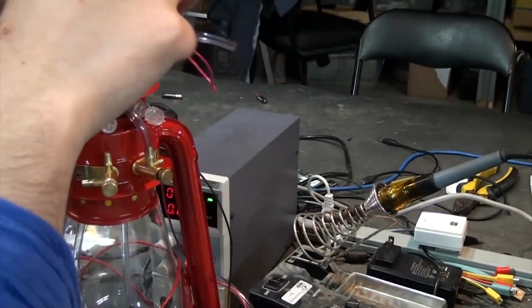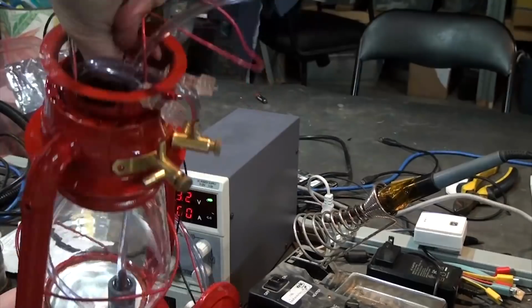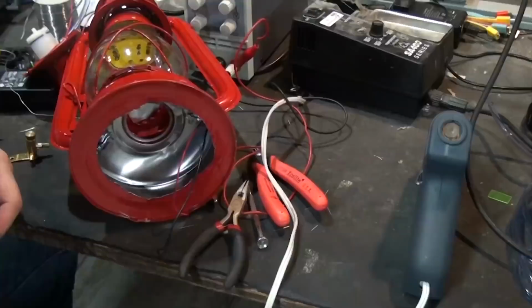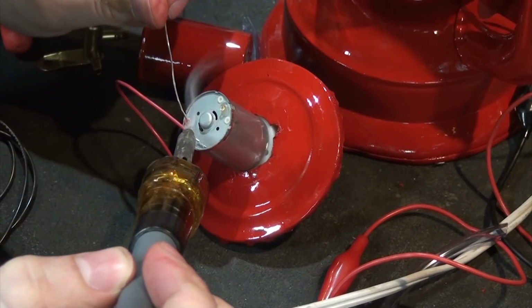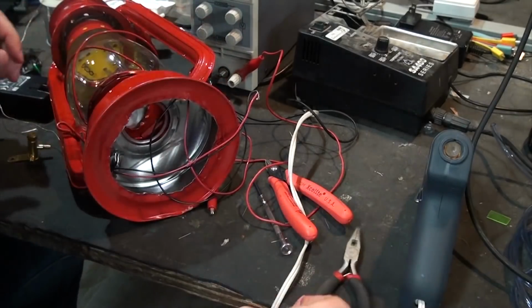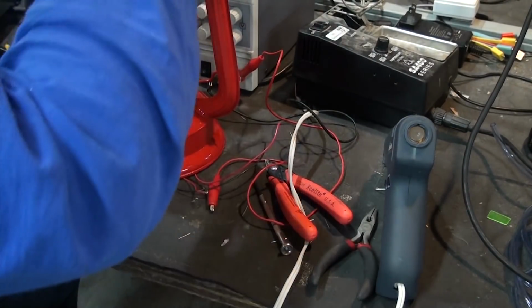Then I could focus on the wiring, so the two wires for the LEDs were fed down one of the arms of the lantern, leaving a bit of slack so that the lantern mechanism could still work. That way I can get the glass chamber back into place later. Then I permanently mounted the pump and wires into the lid, and repeated the same wiring method as before, but with the other arm of the lantern. I didn't feed them all the way until the very end so that I could do all the tubing and stuff.